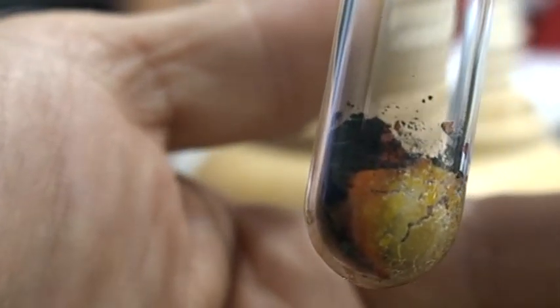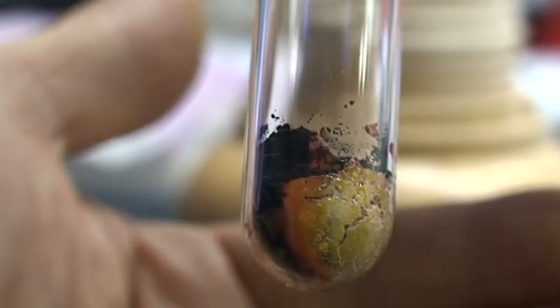The black lead(IV) oxide has actually turned into two other compounds. One is orange and the other is yellow. The orange is nearer to the black, and that orange compound has the formula Pb₃O₄. While the yellow compound is PbO.